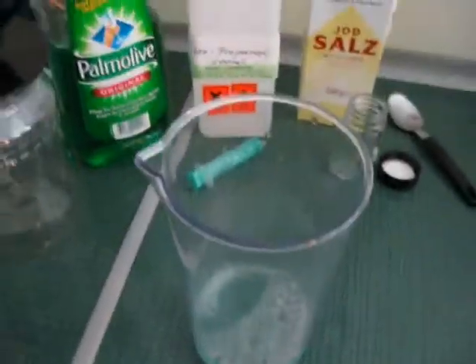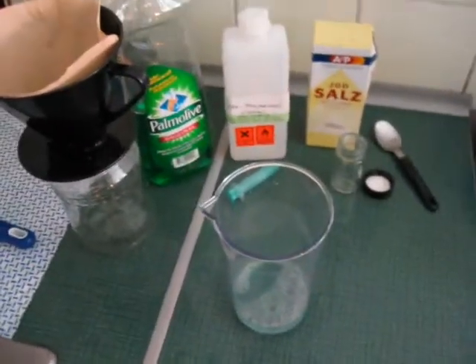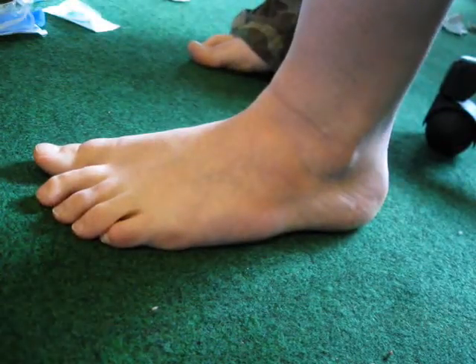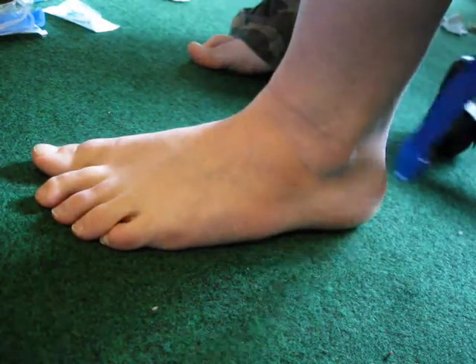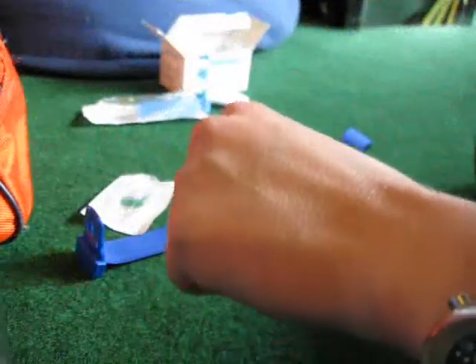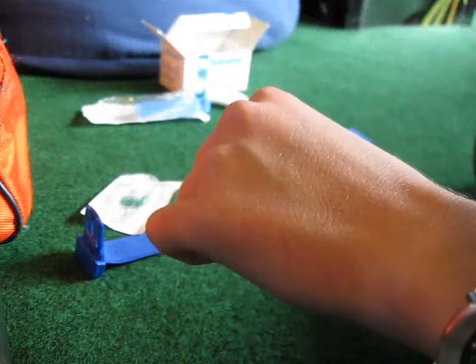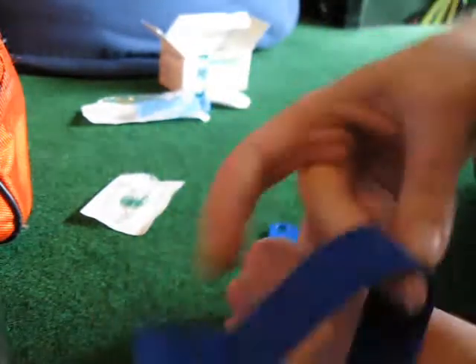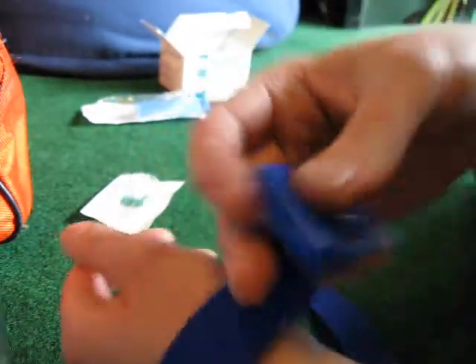Then you need to add the DNA to this. What is probably the worst part is taking the blood sample. I usually do this on my foot, but that didn't work because my veins are not good enough, so I guess I'll have to use my left hand.